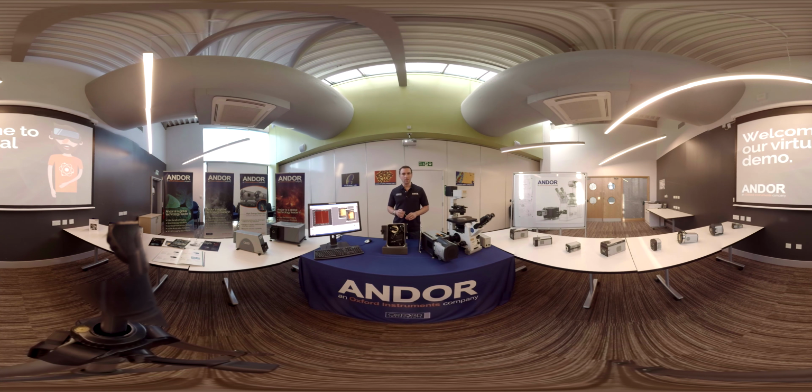The shutter is best in class. It can operate at a sustained 10 Hertz or a short burst of up to 40 Hertz. There's inbuilt intelligence in the electronics to sound a buzzer and warn you if those limits are exceeded, and to prevent the shutter from heating up too much.